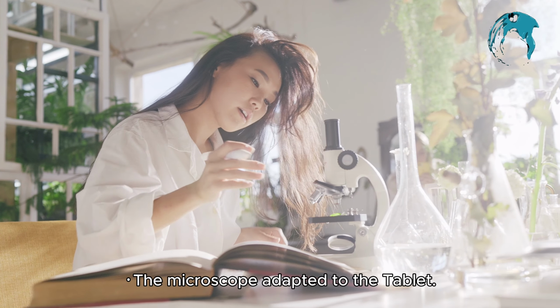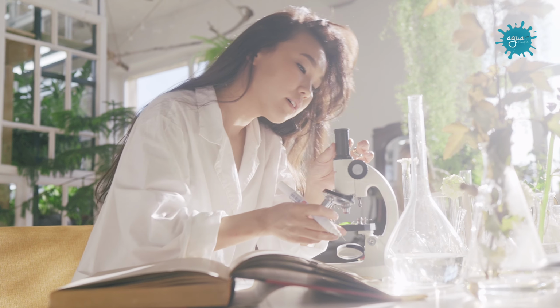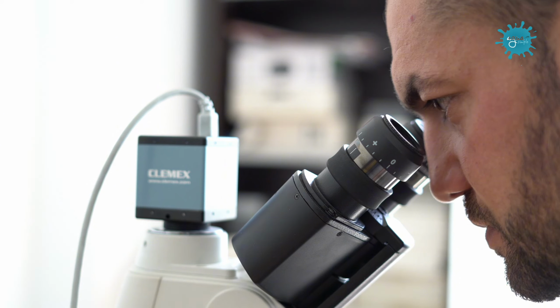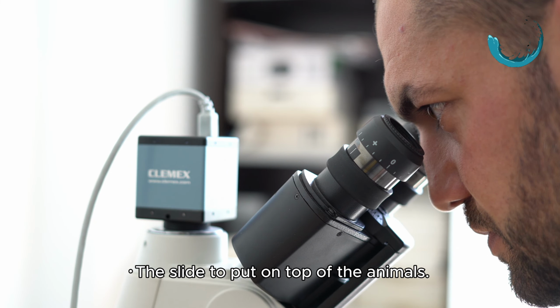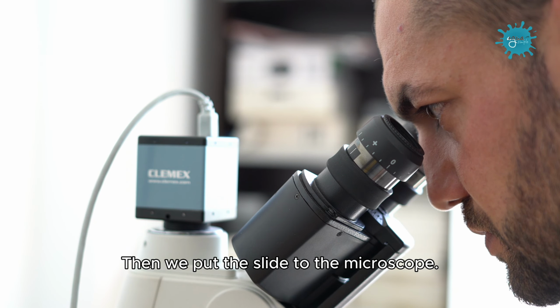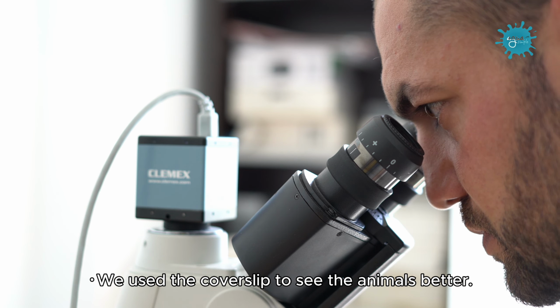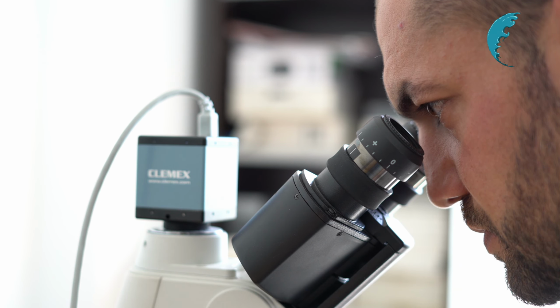The microscope adapted to the tablet. We used the microscope to take pictures of the animals. The slide to put on top of the animals. Then we put the slide to the microscope. We used the cover slip to see the animals better.